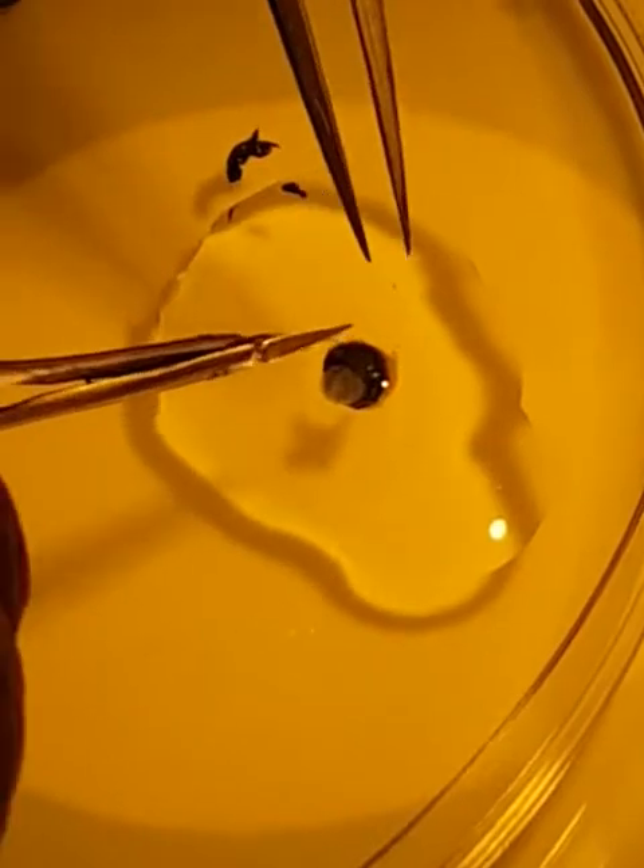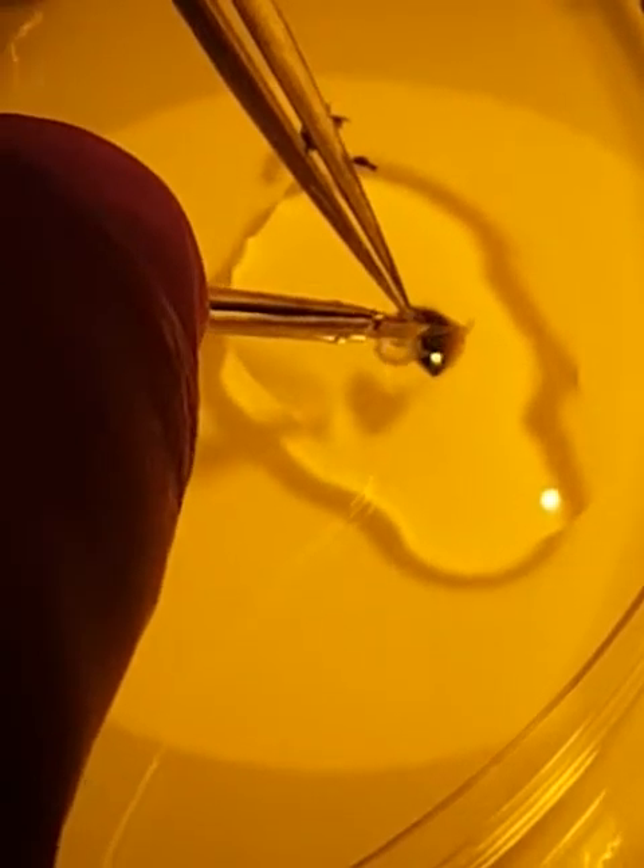Now I'm going to start doing like the petals. I'm going to try to do four deep cuts — I'm going to grab the entire retina and the sclera from one point, cutting from the retina all the way to the top of the sclera.